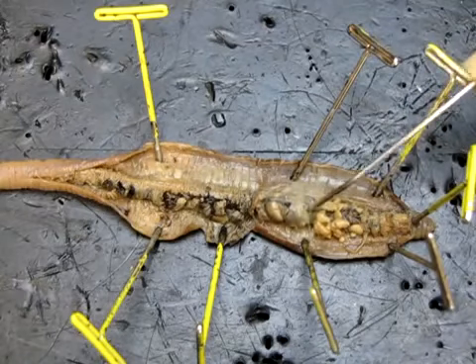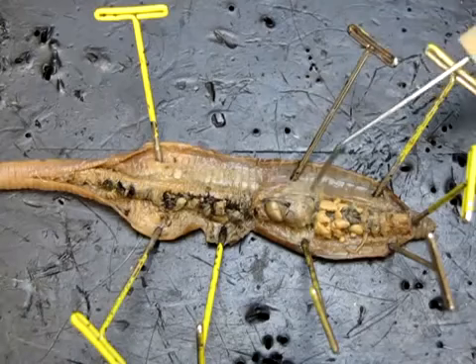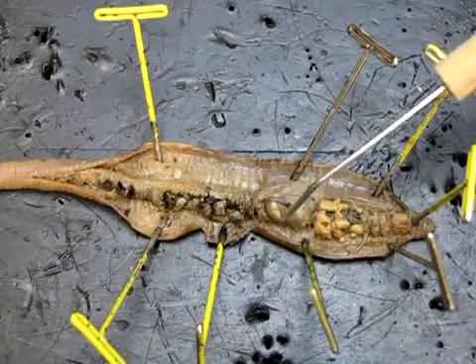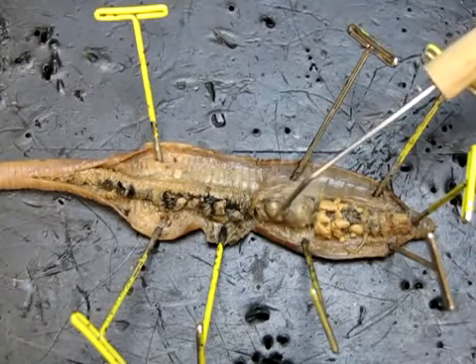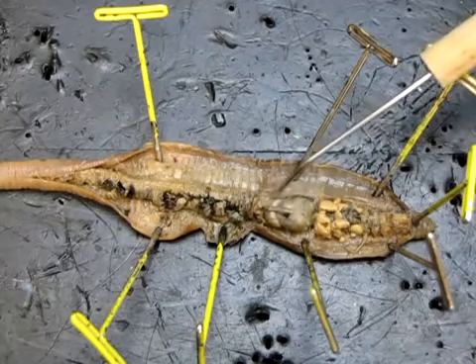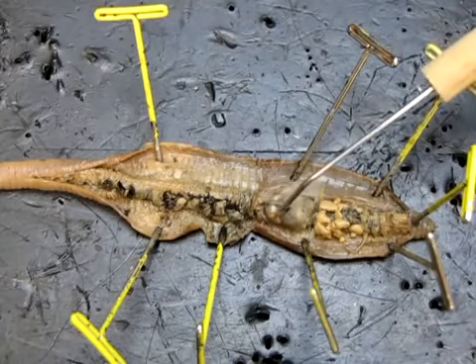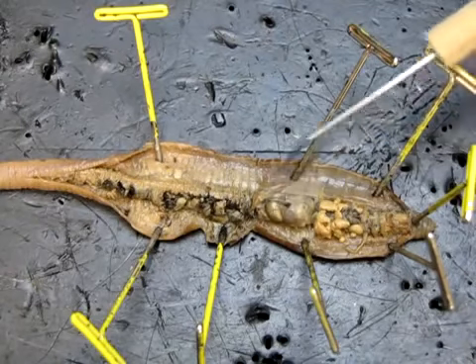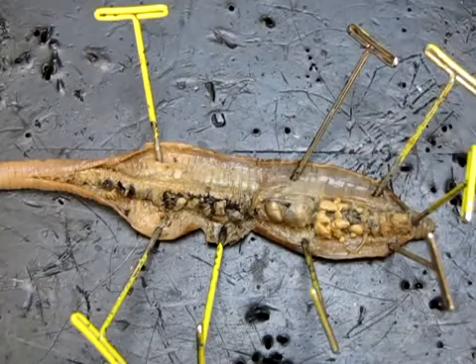So the crop essentially acts as a stomach. It's basically a storage unit for food before the mechanical digestion takes place. Speaking of the mechanical digestion, that's what we find next in this system, this hard-walled, you can see how hard it is here, and slightly paler sac or bag, and this is the gizzard. So the gizzard is a very thick-walled muscular structure which is responsible for mechanical digestion, so physical breakdown or grinding of the food that's coming in.